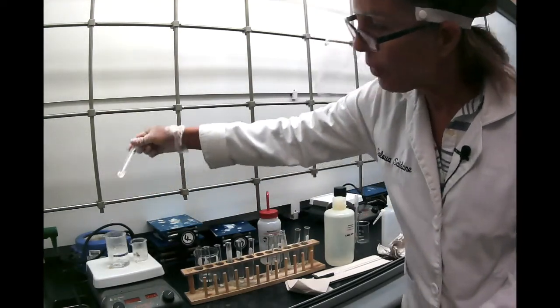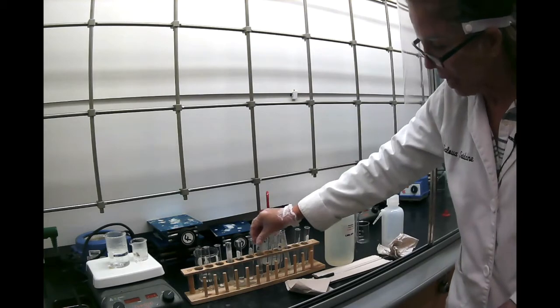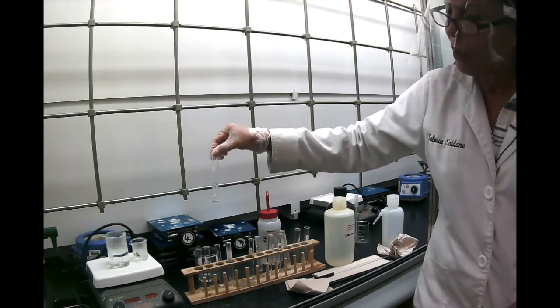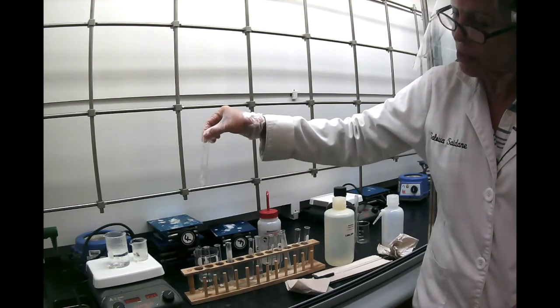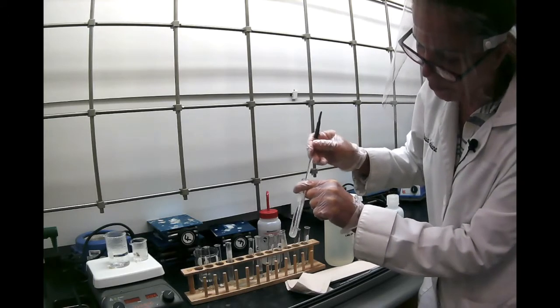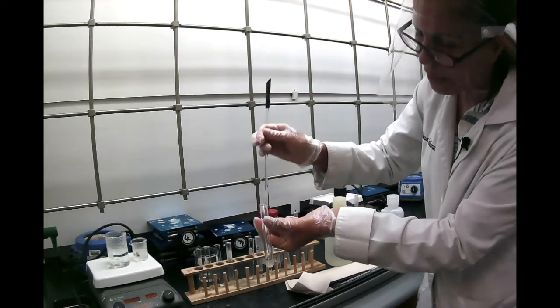Now let me go back to benzoic acid. I just want to show you that it's dissolving. So benzoic acid dissolves in hot water. So we'll put it back here. That's our benzoic acid. Now, this is naphthalene in alcohol. We saw that it doesn't dissolve in water. And since alcohol and water are similar, we should expect similar results. So it doesn't look like it's dissolving in cold alcohol. I'm going to stir it a little bit with the stirring rod. Make sure your stirring rod is always clean. And just like we did before, if it doesn't dissolve in cold, we're going to heat it a little bit.